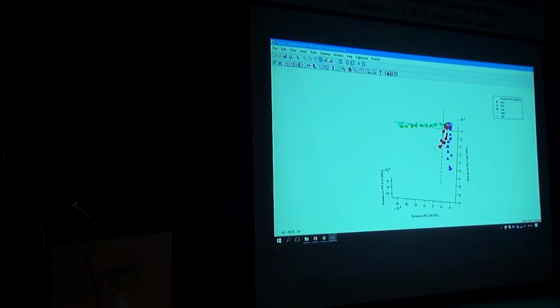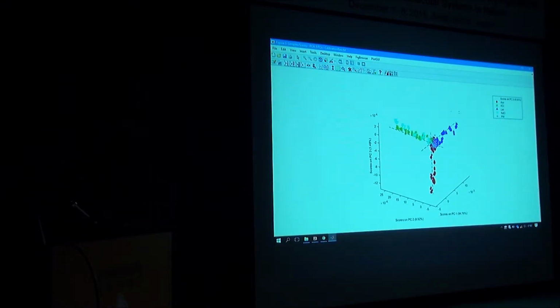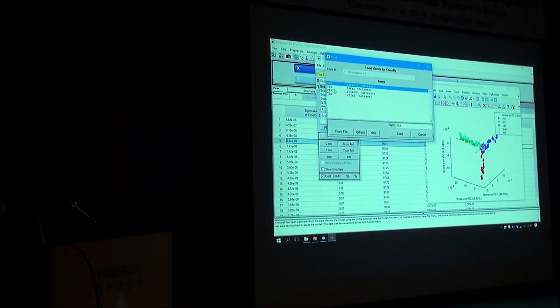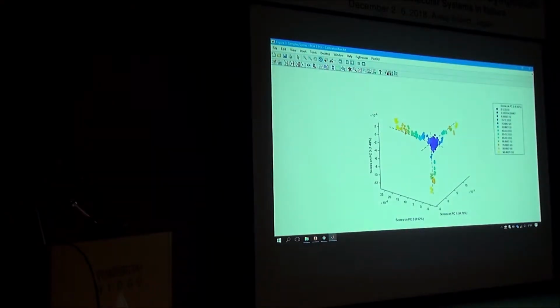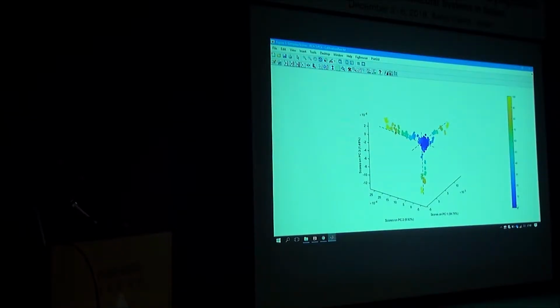It is clearly 3 orthogonal directions. Lactate, 2 salts that are very similar to each other, and the third one acetate, and water bang in the middle. So now I want to overlap the concentration gradient. So if you go color by, you can load your concentration data on top of that. You say, we load from the Y block and molar concentration. So you can see from low to high, you can add a gradient bar there. 0 concentration to 100 millimolar. Each salt clearly showing that pattern there.